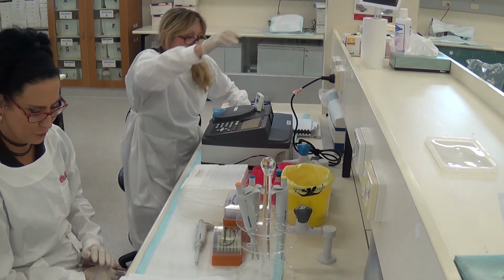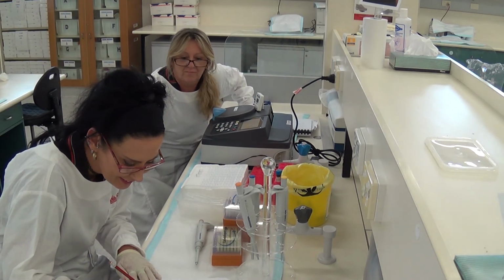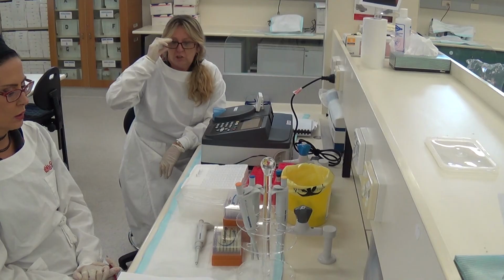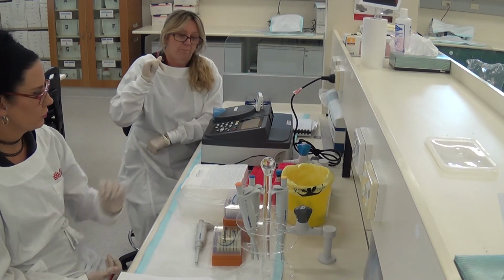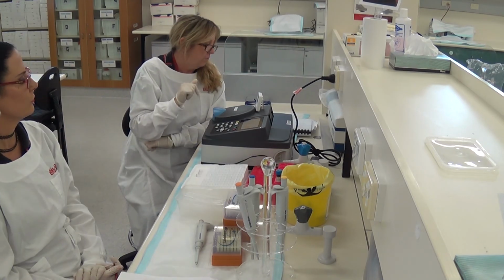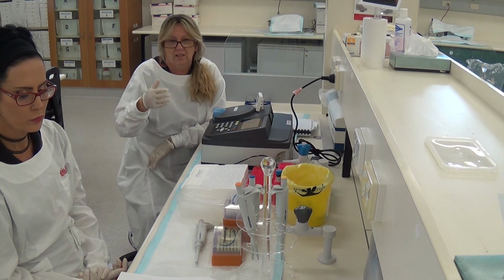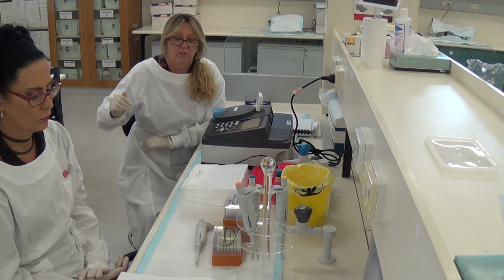All right. Last reading, 0.569. Beautiful. Okay, so I will stop that. So that's the end of our 1 molar and our 0.5 molar. So we do need to keep going ahead, and we need to now test the 0.25 molar, 0.125 molar, and 0.0625 molar. So when you have a look at those molar concentrations, you're going to notice that they're just halving as they go down, okay? So it's just a serial dilution as we go down.